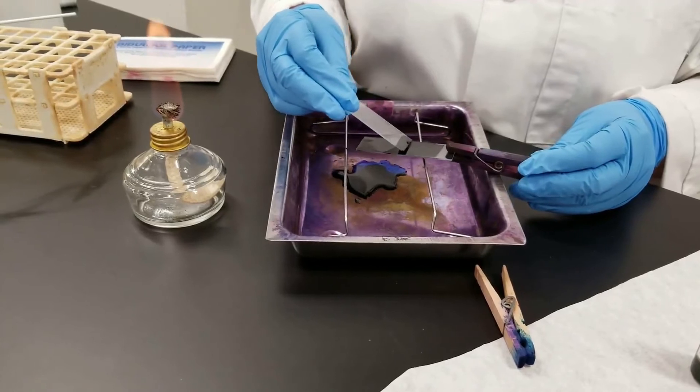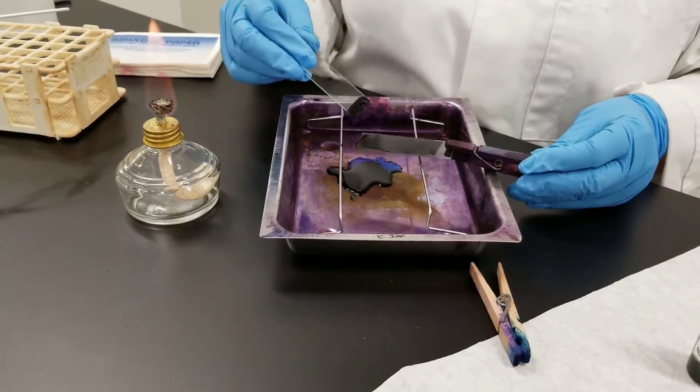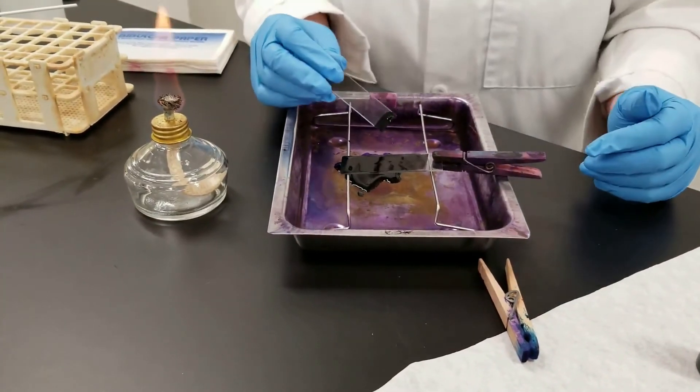We can probably pull a little more excess off because it can be rather messy. We'll let that sit and just air dry. So we're just going to let it remain there.